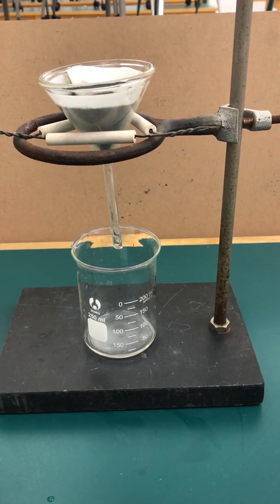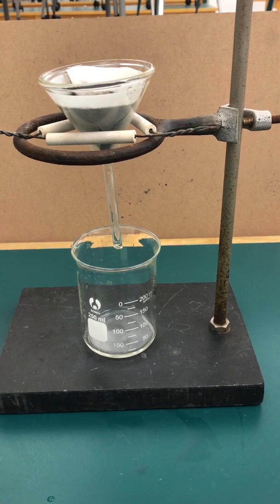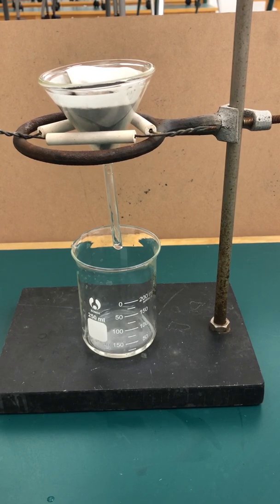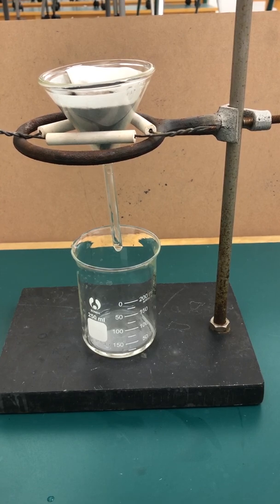The process is slow because it's by gravity. You can see it dripping down the bottom there. Remember, the more liquid you had to filter, the longer it's going to take. That is why we told you to not add too much water when you first dissolved your copper-containing compound. And that's why we're limiting how many rinses you do. As it's dripping, you are trying to get rid of the excess sodium hydroxide. After this is all filtered, we're going to dry the filter paper with our copper-2-oxide product. You want to make sure you get rid of all the excess sodium hydroxide. Otherwise, once the water evaporates, some of that residual sodium hydroxide will also stay there and affect our calculations. We're going to let this finish filtering. When it finishes, we're going to rinse the filter paper with a few milliliters of distilled water again.